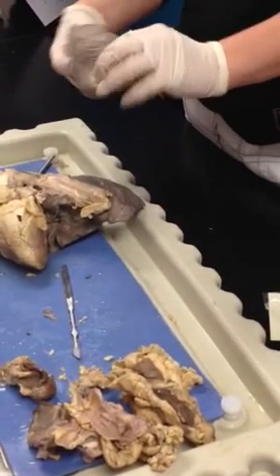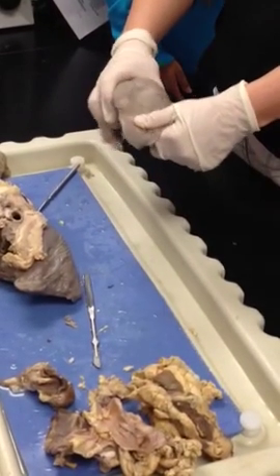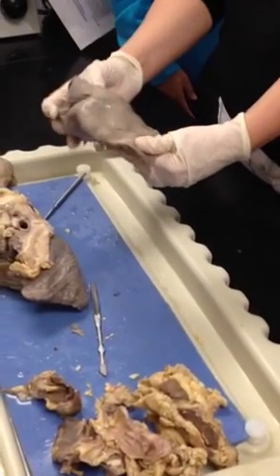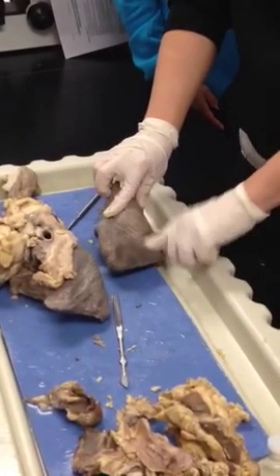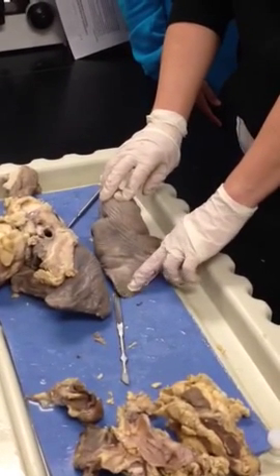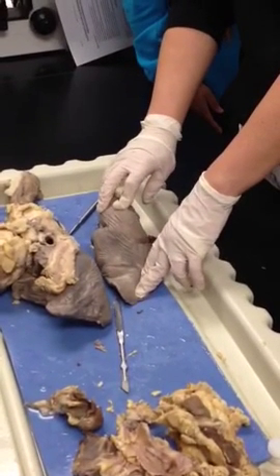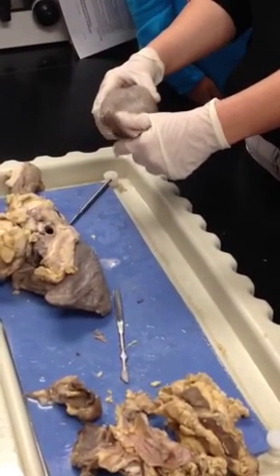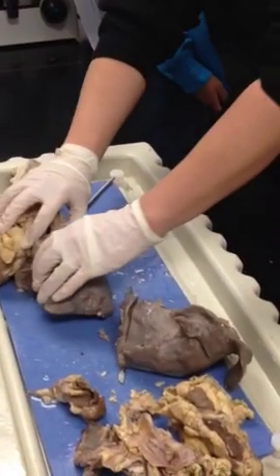We will also put it out and ask you about the lobes. Obviously, this lung isn't the best one to ask because it folds up. But we'll have nice lungs that fold out so that you can see the different lobes. We'll also lay out a lung and ID this and ask you what lobe it is. So if I asked you what lobe this is, what would you tell me? Superior. Superior lobe of what lung? The right. No, you're right. It's the left. You need to be able to tell me if it's the right or left lung, too, in your answer. Don't leave out the right or left side. You have to be able to tell the difference.